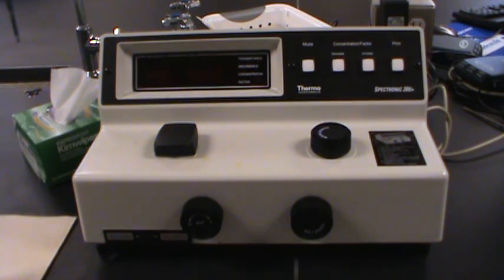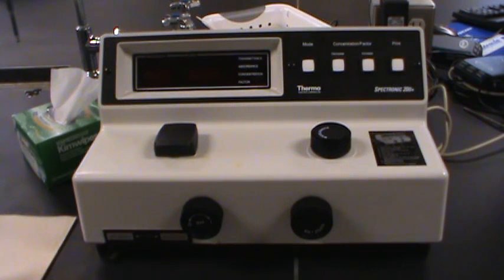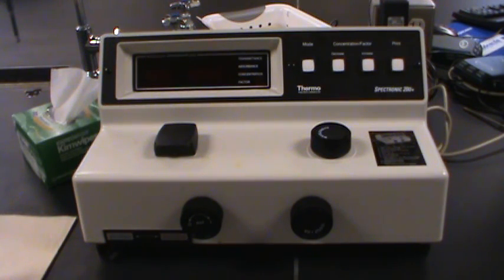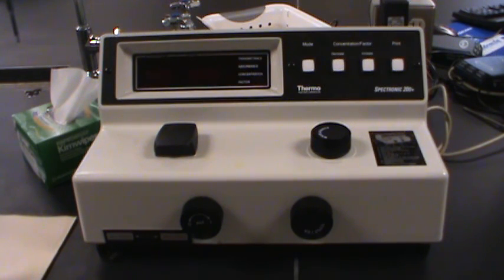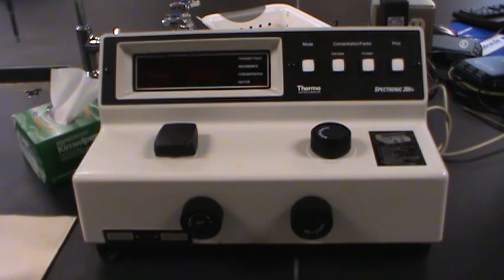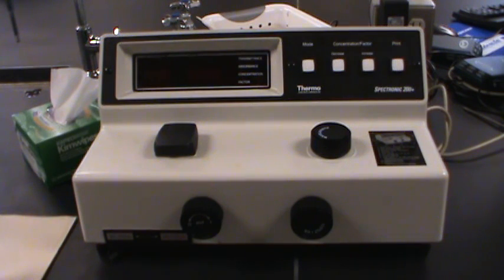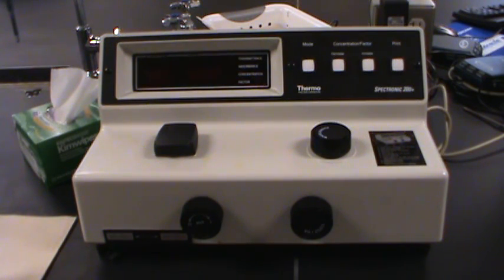So what you see right now is going to be your most important tool in understanding how color behaves. It's a spectrophotometer. So let's take a little tour of this spectrophotometer and see what things it can measure, what things it can do.